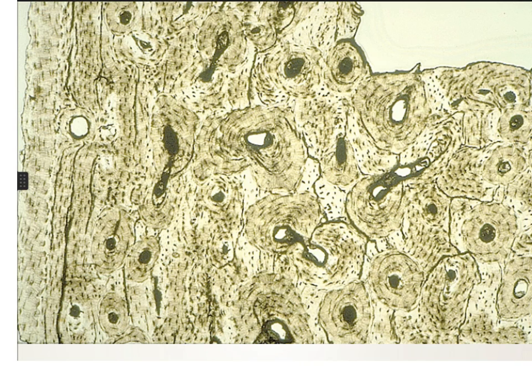Each Haversian canal is surrounded by concentric lamellae of the calcified collagen, and in between these calcified lamellae we have the rooms of the osteocytes. So if we have a label here for this area, these are the concentric lamellae, and if we have a marked enlarged picture and we have a label for this black dot here or black line, it is the lacuna.